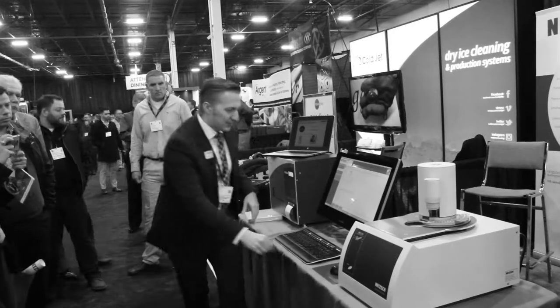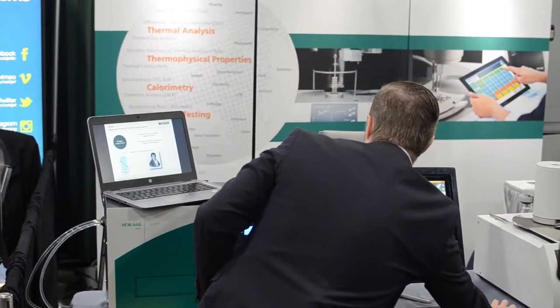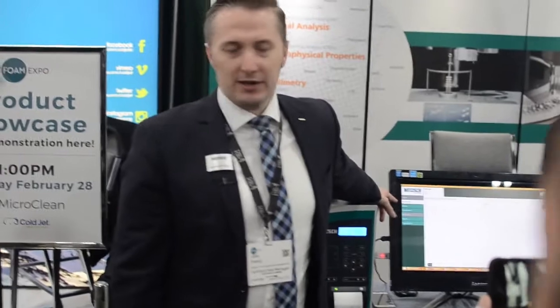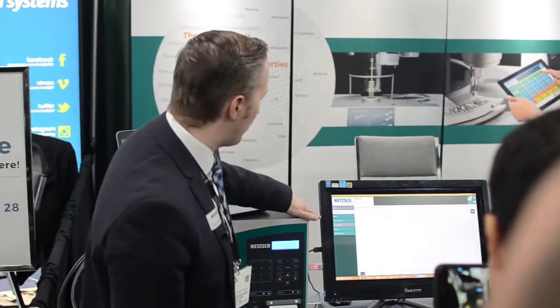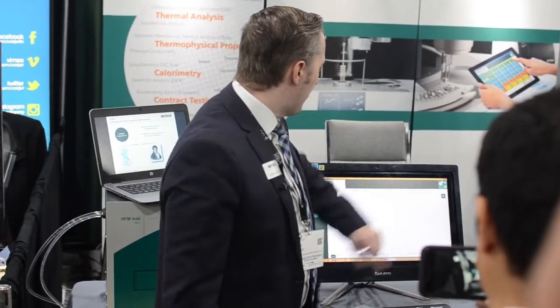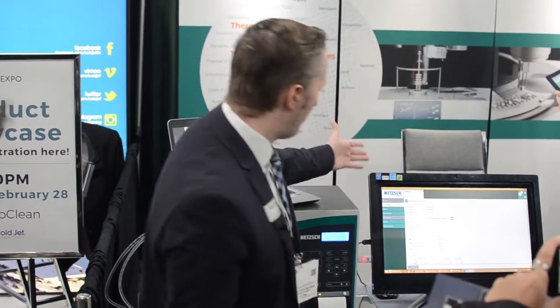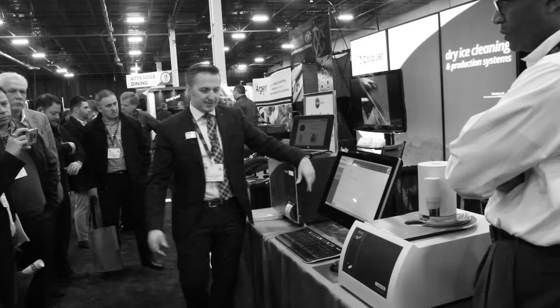With an instrument like this, we need to add some information in the software. I'd like to explain how the software works. You have the possibility to create so-called user methods — you can create a special method for every kind of foam, or for any kind of operator. Here I created a method called FoamExpo. It comes up with some basic information and basic input data, and then I need to add the sample ID.